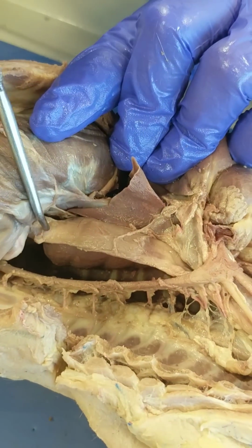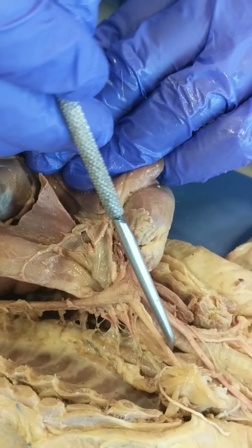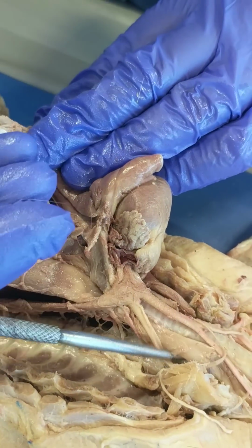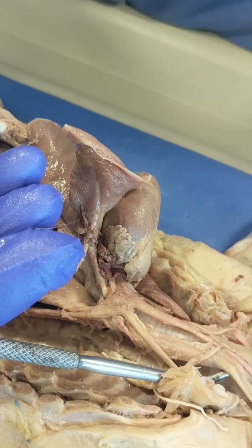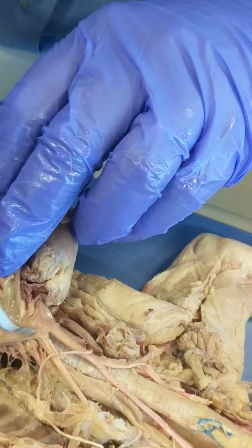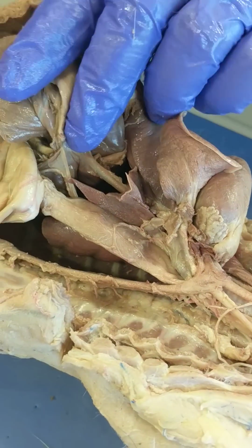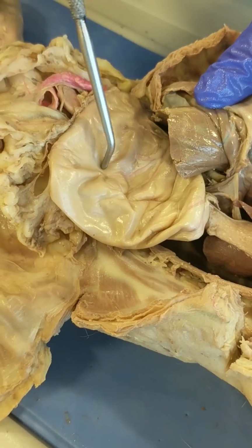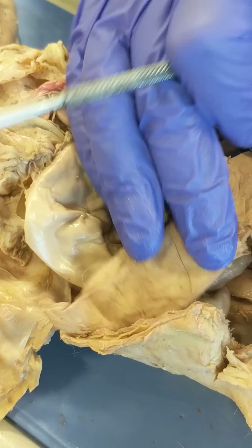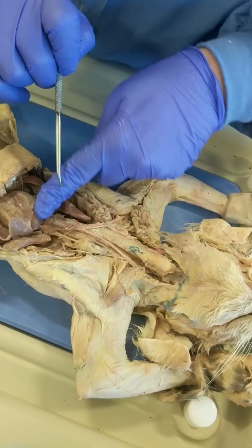Also descending is the esophagus, which was under the trachea over here. This is esophagus. This is esophagus. I'll lift the trachea up. And it continues, so that's esophagus. And it's going to lead all the way down through the diaphragm and into the stomach, which we're going to talk about soon. Now, of course, the trachea will not extend beyond this region.